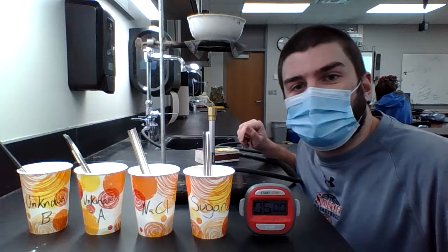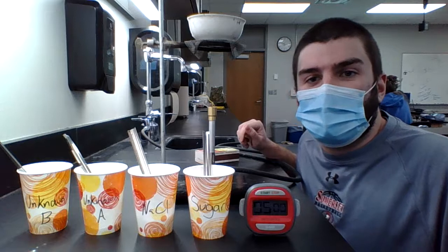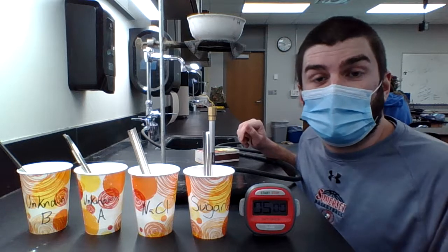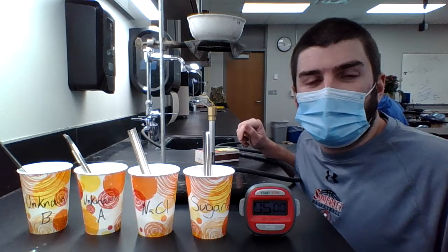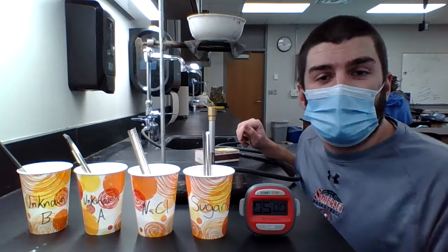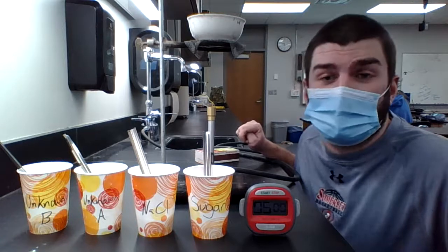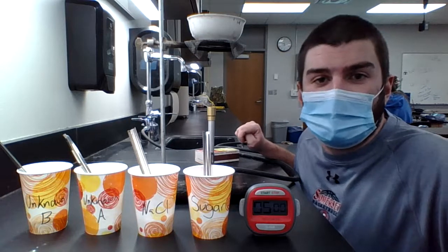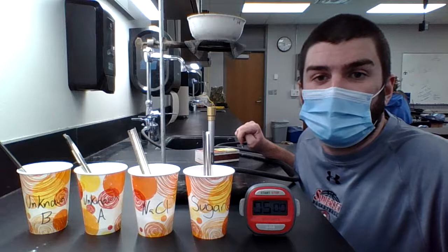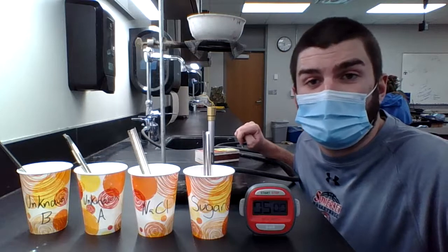How's it going, physical science? So this is our lab demo for ionic or covalent strength bonds lab that we did on Thursday. I'm making this video just for the people that are home so they have data, or in case that you weren't able to complete the lab, you have data that you can use for the conclusions and analysis of the lab.